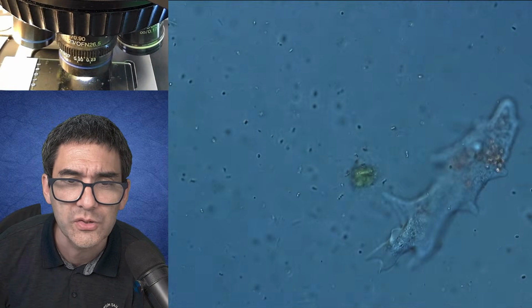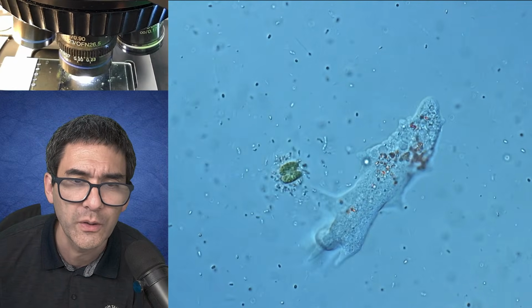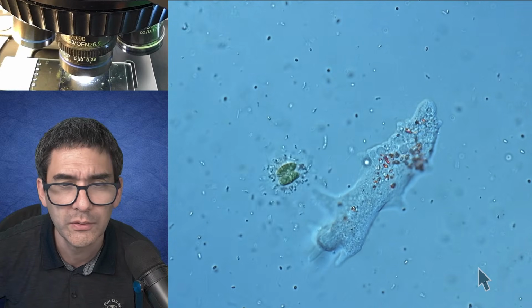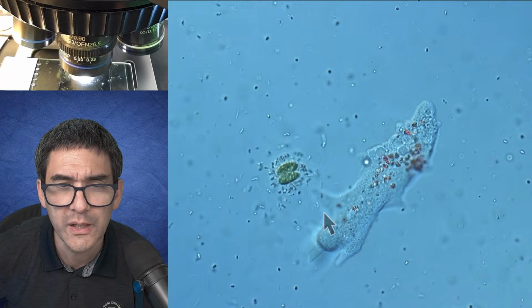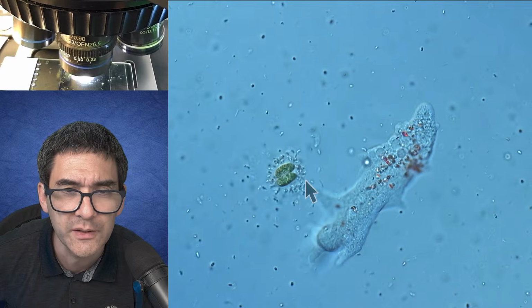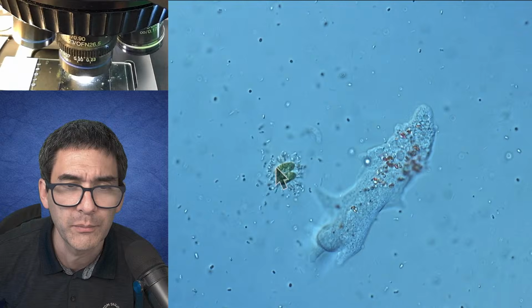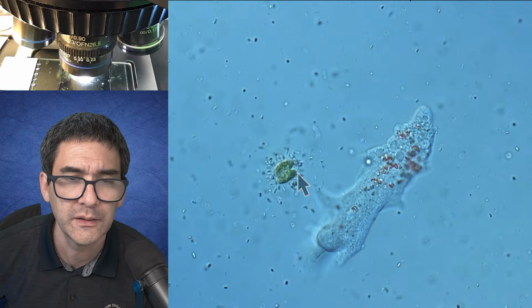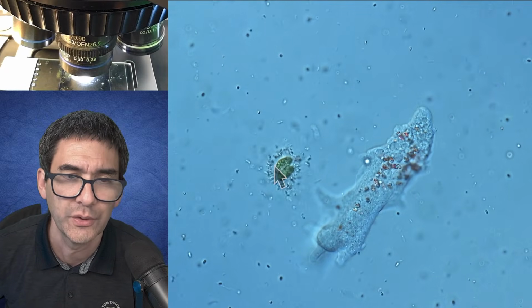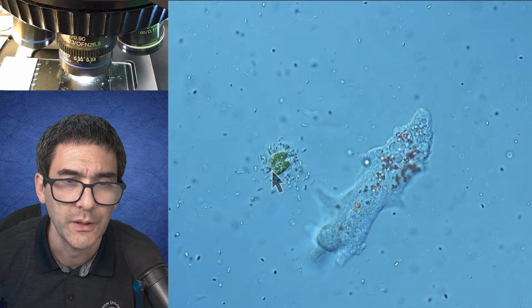Gosh, it's too dark. Okay. So this is actually also something that you see quite frequently here. Again, where is the arrow? This thing here, again, of course, an amoeba, right? Not moving very quickly, but this one is quite interesting. Those tiny little things here, these are bacteria, of course. And this one here is green. So that's an algae and producing oxygen. And very often you see that you will then have bacteria gathering around algae because they need oxygen.